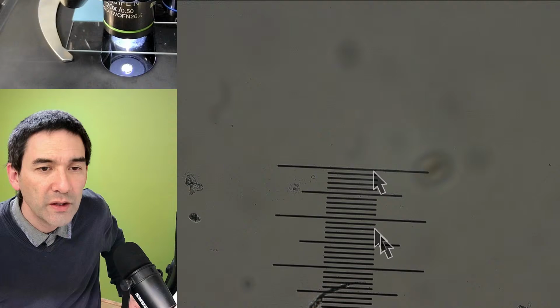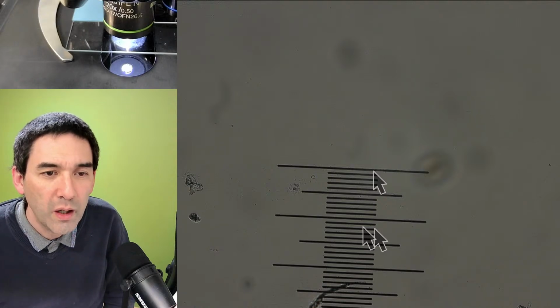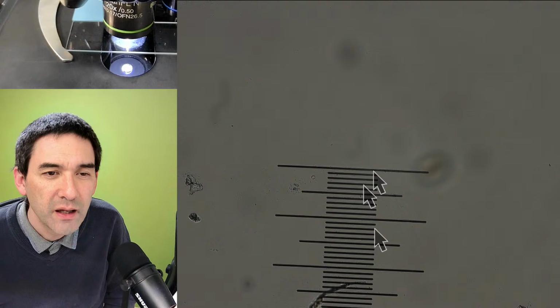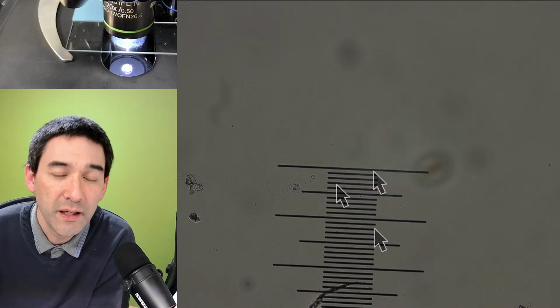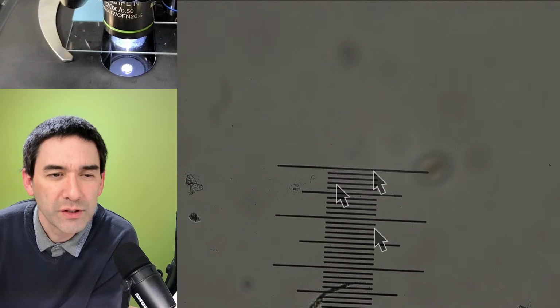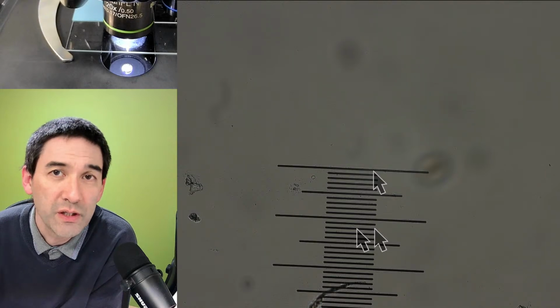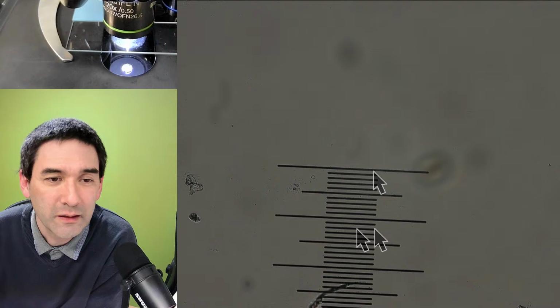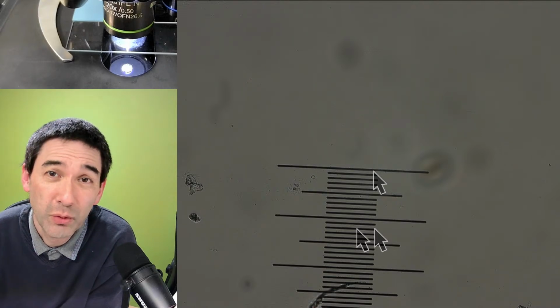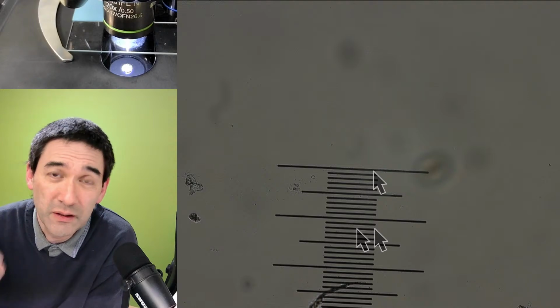So I have got a third arrow here. So that is 1, 2, 3, 4, 5, 6, 7, 8, 9, 10, 11, 12. So 12 times 10 micro. Well, that's actually just a second. One division here, it says, is 10 micrometers, 20 micrometers, 30, 40, 50, 60, 70, 80, 90, 100, 110, maybe 120 micrometers, which is approximately a little bit more than 1/10 of a millimeter, if I did my math correctly. Yeah. So basically, if you are to see it separately, then it's like a tiny dot.